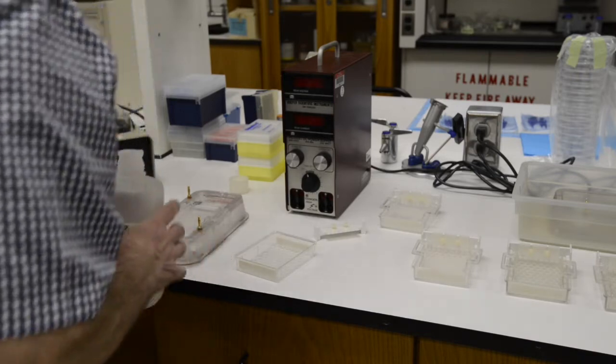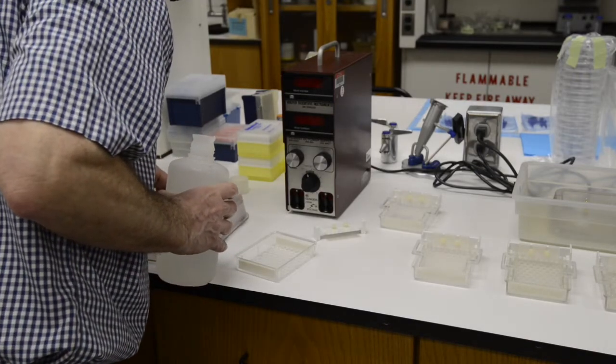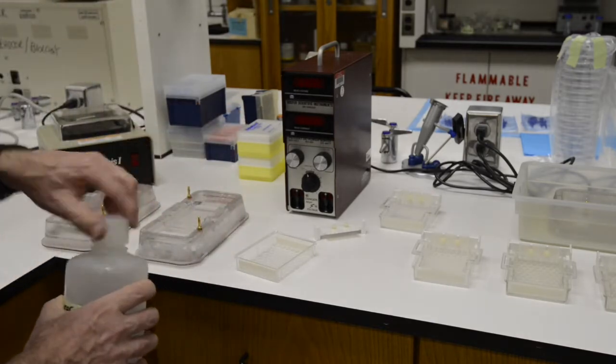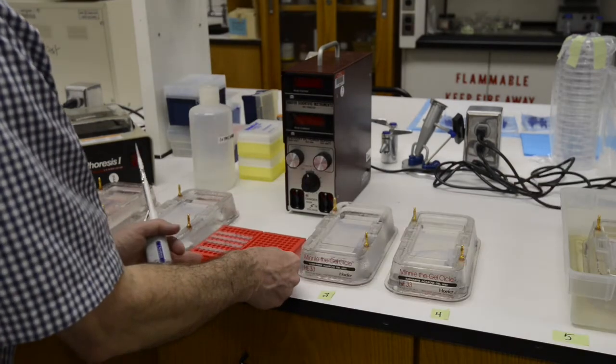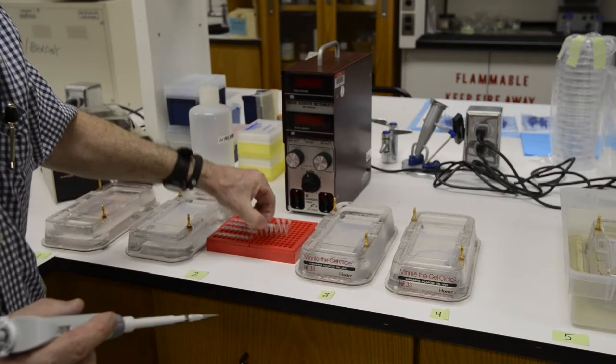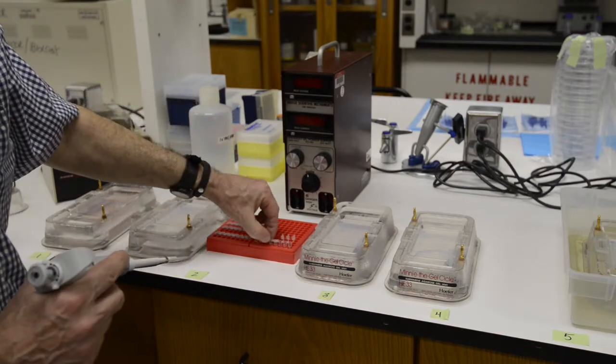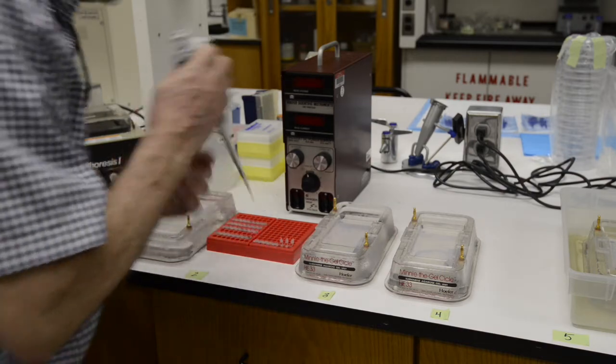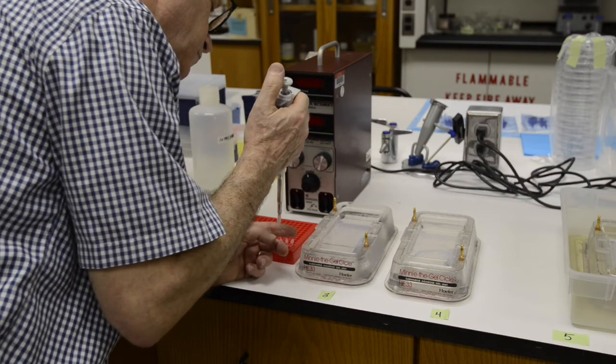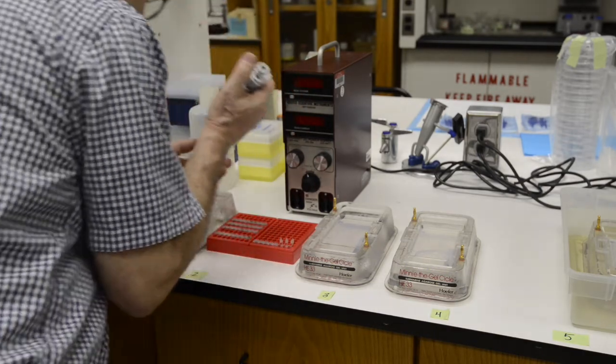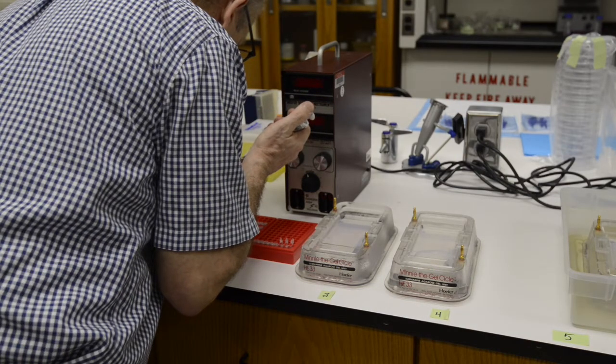Now you're ready to take your PCR samples as well as a DNA ladder and put those samples and the DNA ladder into the wells of your gel. You will want to pipette 5 microliters of your PCR sample into each well of the electrophoresis gel. Remember that you want to save the rest of your PCR product so that if you had successful amplification, you will be able to send that amplified DNA for Sanger sequencing.